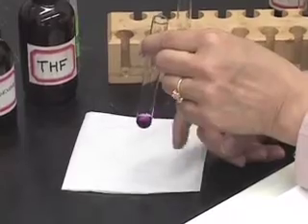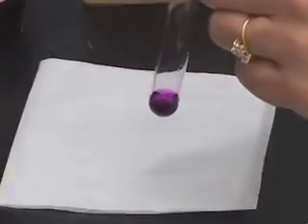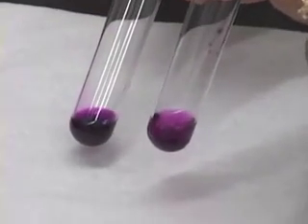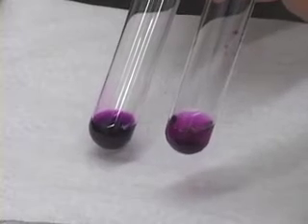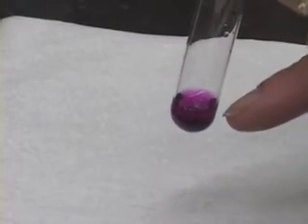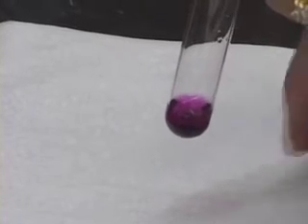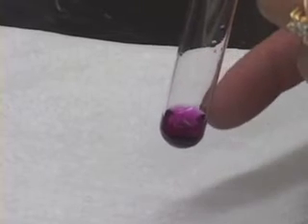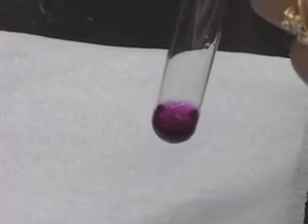Mix it. What happened? Let us go back to our test tube which just had potassium permanganate — you don't see any difference in color. Which means potassium permanganate added to this cyclohexane in THF did not get used up. There was no reaction. The compound here then should be a saturated compound.